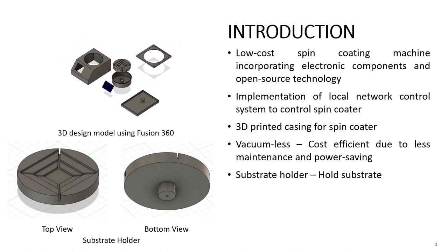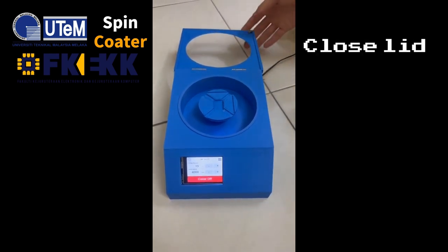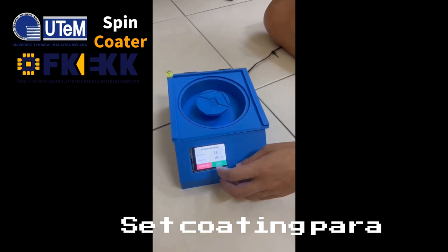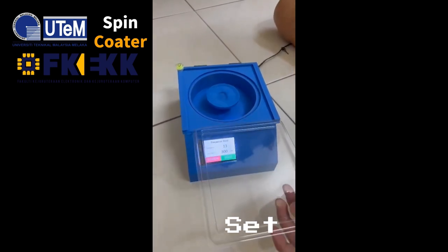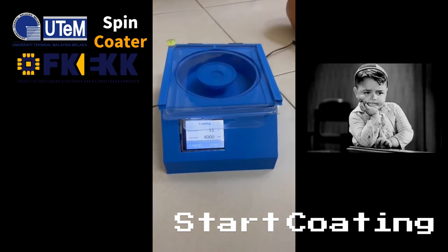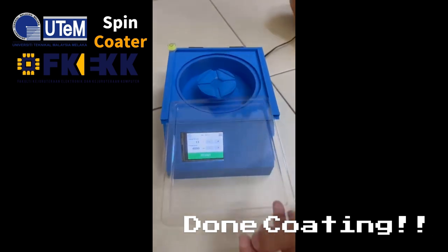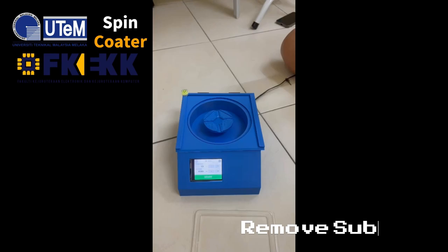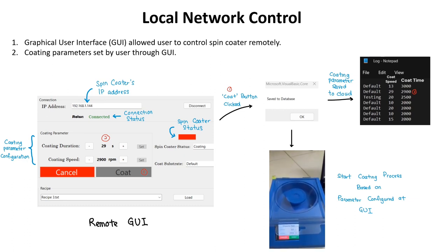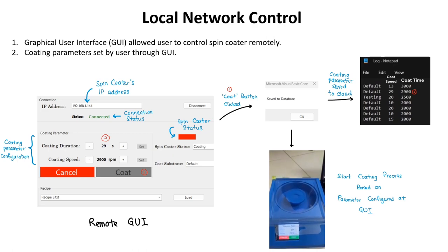Overall, the performance of the low-cost spin coater is comparable to commercial spin coaters. The GUI allows the user to control the spin coater remotely within the same network and can also access the database. Users can configure the coating parameters through the GUI. Once the user clicks the coat button, the parameters will be saved into the database and the coating process will start.